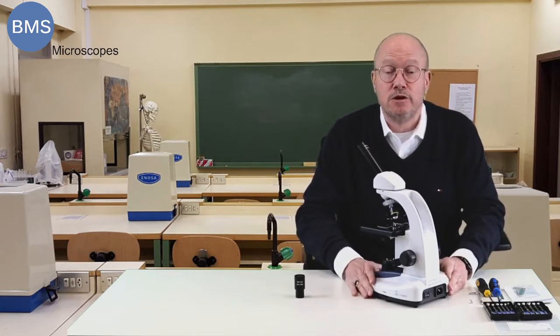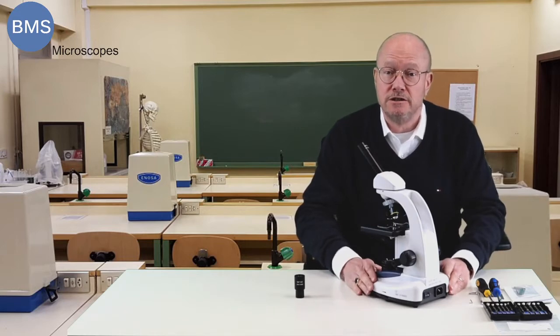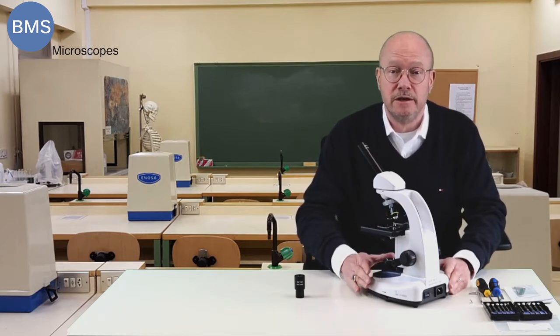That might be the case if you want to do some measurements, you want to change the standard eyepiece for one with a built-in reticule.